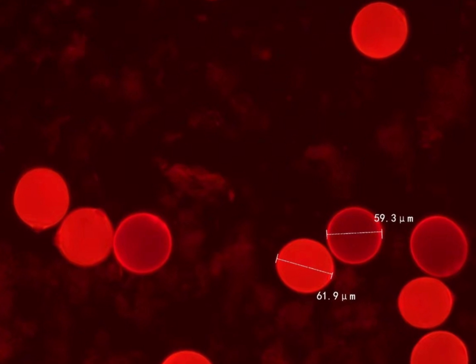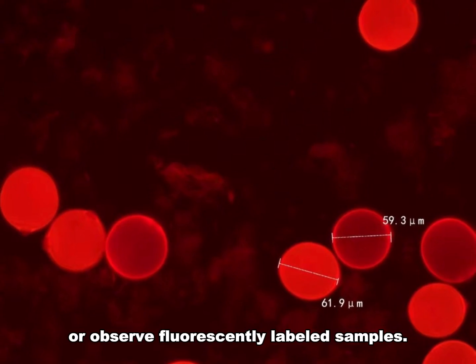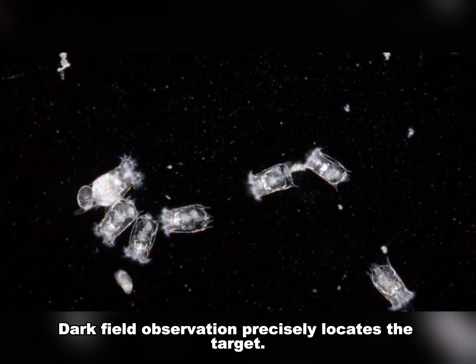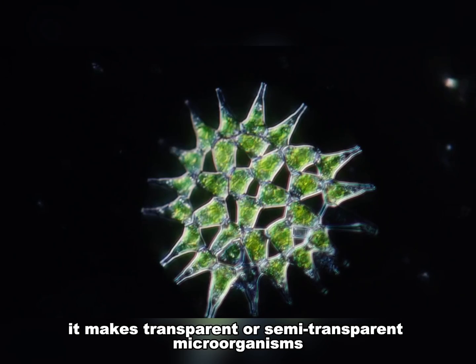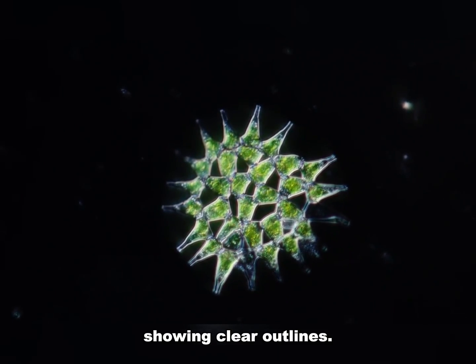Fluorescence observation is used to track specific new pollutants or observe fluorescently labeled samples. Dark field observation precisely locates the target. It makes transparent or semi-transparent microorganisms show clear outlines.